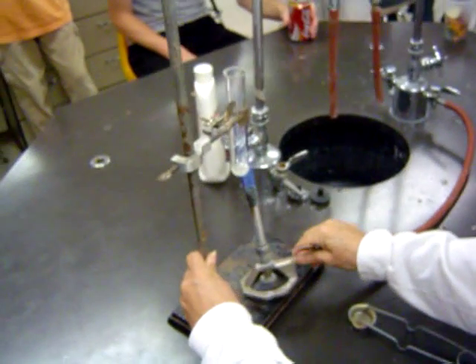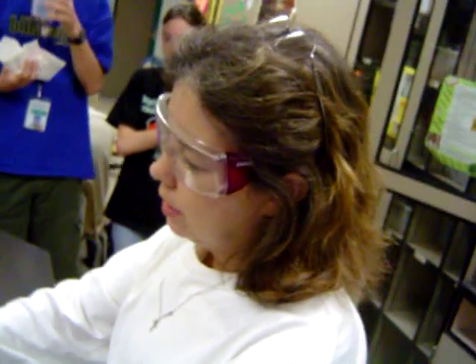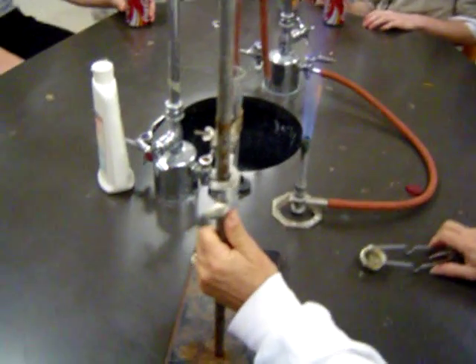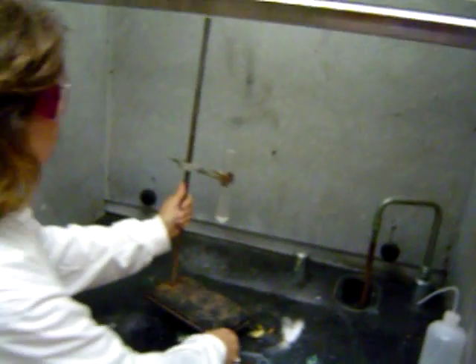Potassium chlorate and we're going to put a sugar compound, a gummy bear, in here and he's going to meet his maker. Lots of oxygen will be produced so he will go crazy.